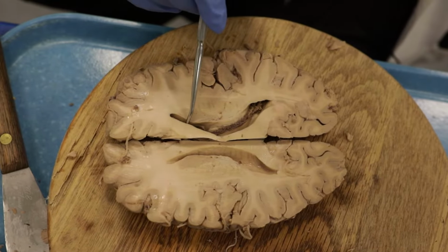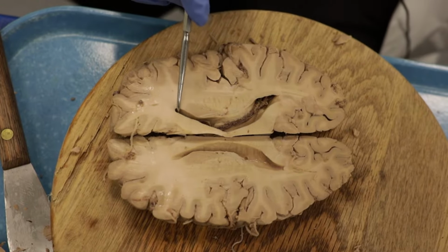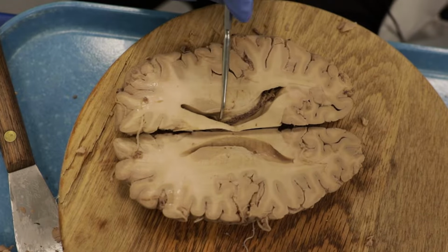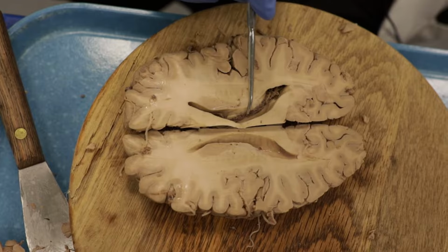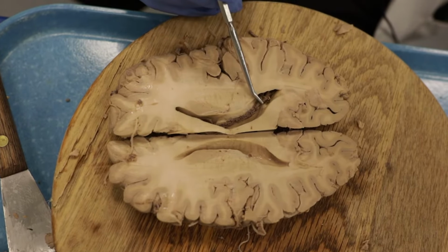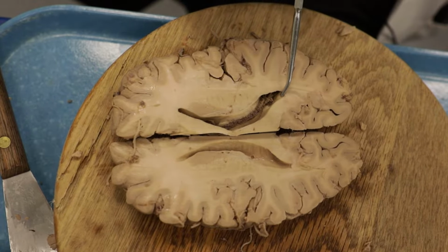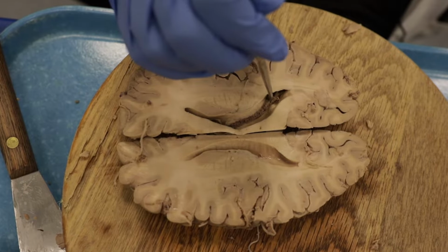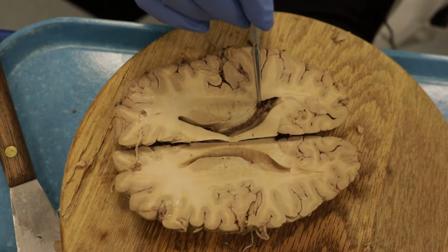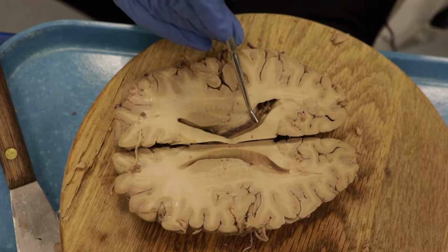All right, as we look at the lateral ventricles here, the part of the lateral ventricle projecting into the frontal lobe is the frontal, or sometimes called the anterior horn of the lateral ventricle. This whole middle portion here is the body of the lateral ventricle. And this area back here is the atrium of the lateral ventricle, which connects the occipital or posterior horn of the lateral ventricle back here with the deeper one. If we were to follow this probe and go deep, we'd reach the inferior or temporal horn of the lateral ventricle. So the atrium connects the occipital and the temporal horn of the lateral ventricle back in this location.